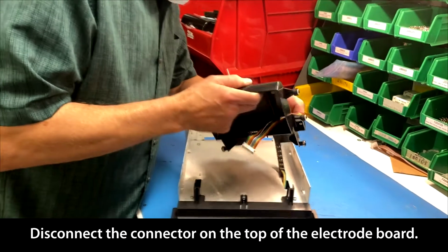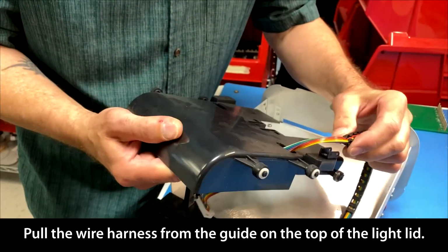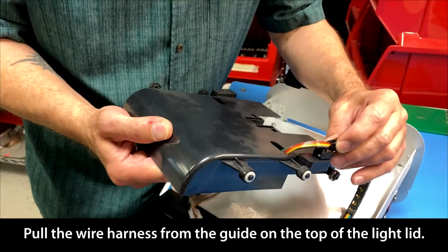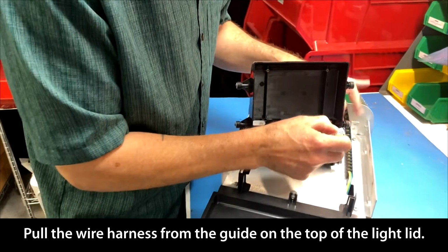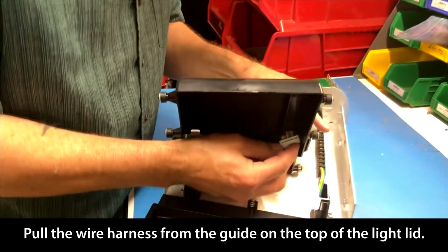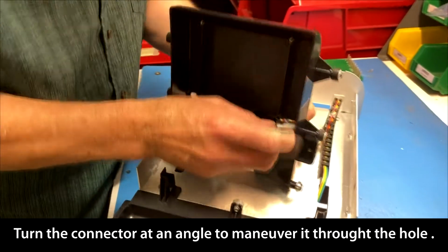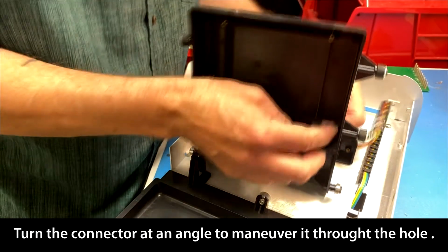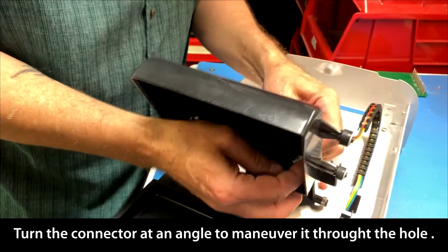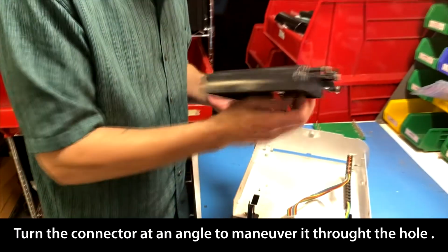Now we're going to disconnect this. You just pop that off. Now this is a little tricky to get this part out. You have to angle it a little bit. You can't just pull it out, it won't come. So you've got to angle it a little bit like that, and then push it out, and now your light block lid is detached.